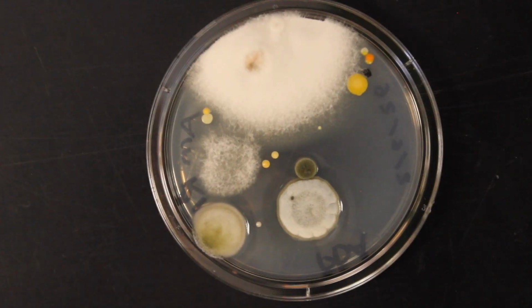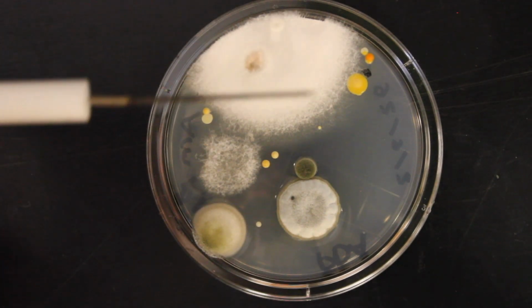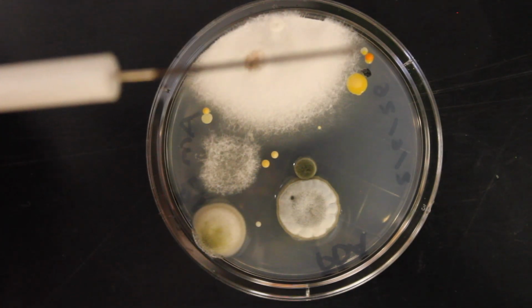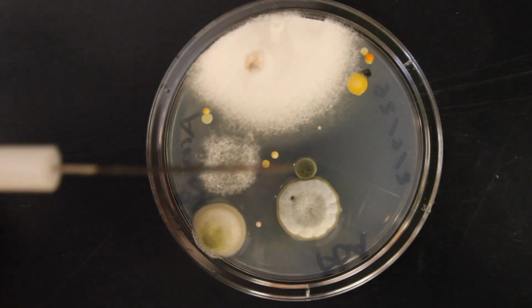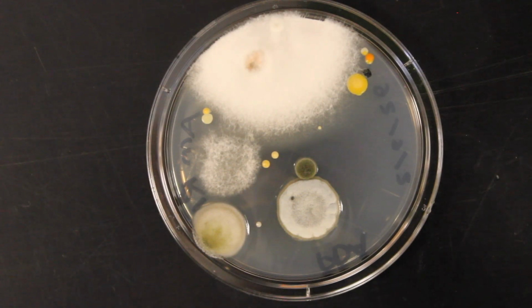Okay, so here is a contact plate. This contact plate is PDA. This then was smashed against the keyboard of a computer and then was incubated. And here we can see that we have growing on this both fungi and bacteria. Fungi are fuzzy, like this big one is clearly a nice fuzzy fungus. Other ones in here you can see are fuzzy, and then we can see our slimy ones, which are bacteria. So you can go ahead and look at those, make your estimates, and record your data.